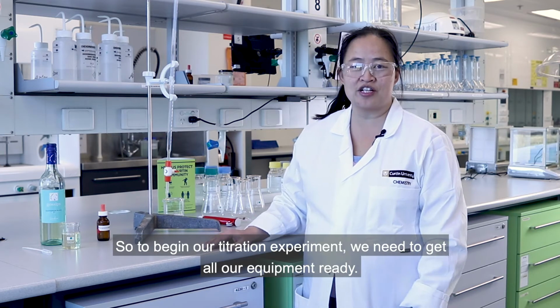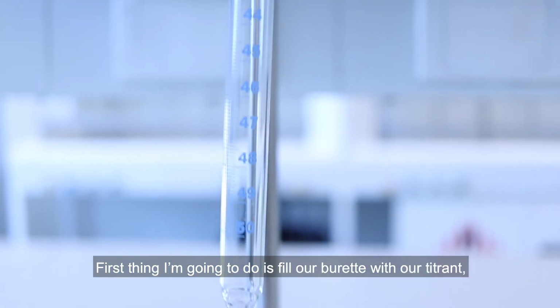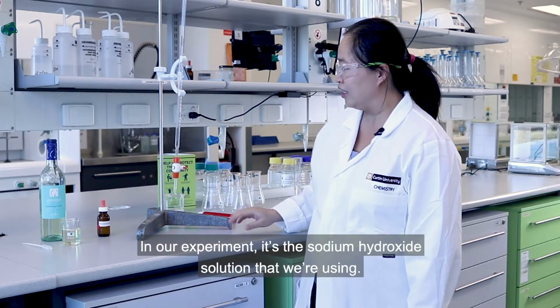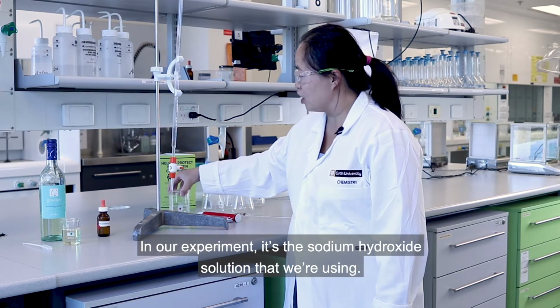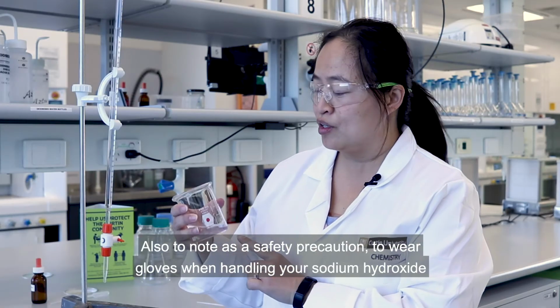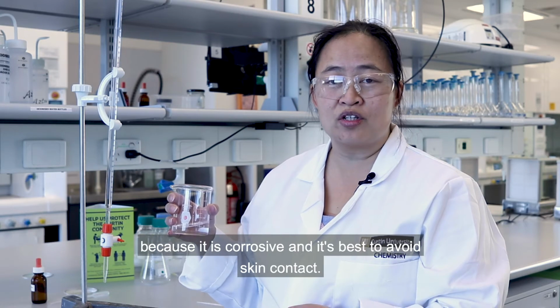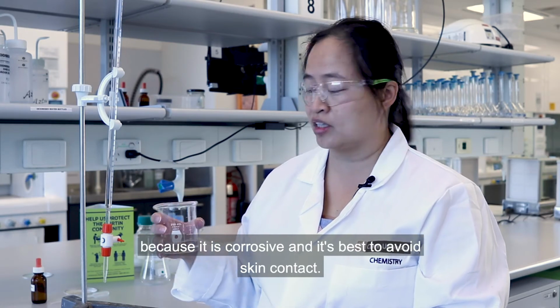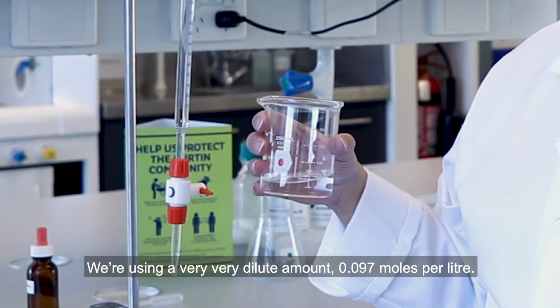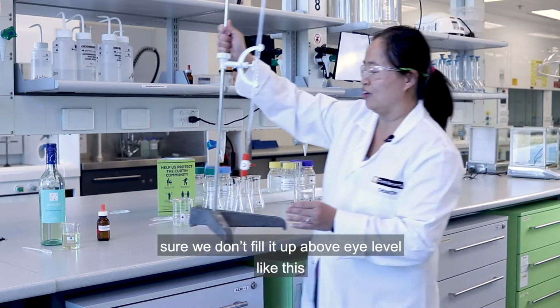All right, now we can get started with our titration. To begin our titration experiment, we need to get all our equipment ready. First thing I'm going to do is fill our burette with our titrant, or the solution of known concentration. In our experiment, it's the sodium hydroxide solution that we're using. Also, as a safety precaution, wear gloves when handling your sodium hydroxide, because it is corrosive and it's best to avoid skin contact. We're using a very, very dilute amount, 0.097 moles per litre.